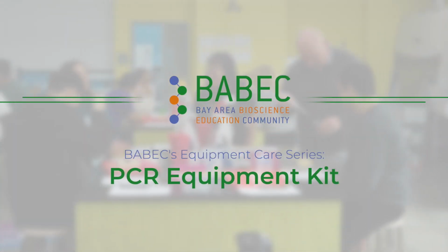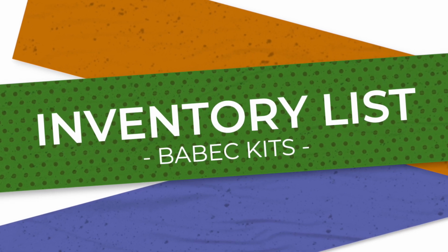In this video, we'll take a look at what's in your PCR equipment kit and how to clean, store, and troubleshoot issues that may come up with the equipment. First, let's make sure that the kit is complete.